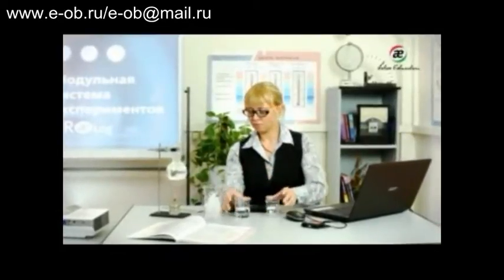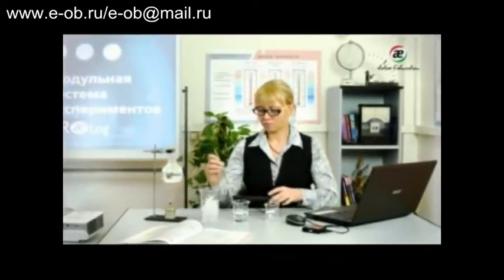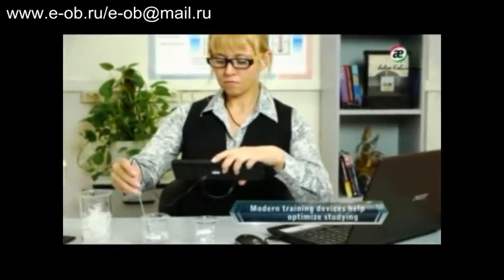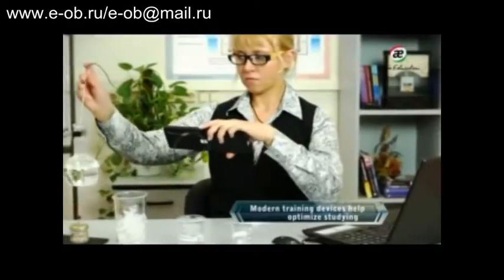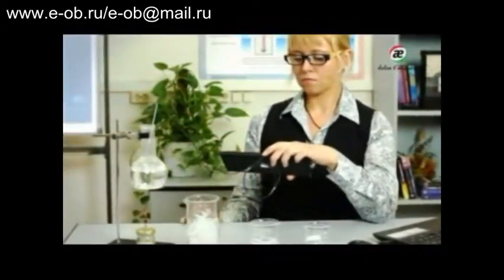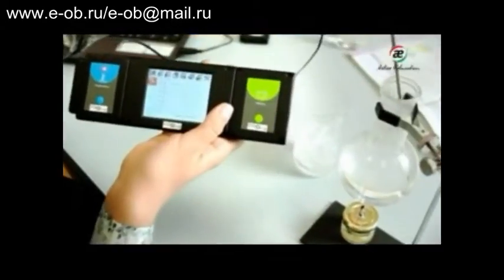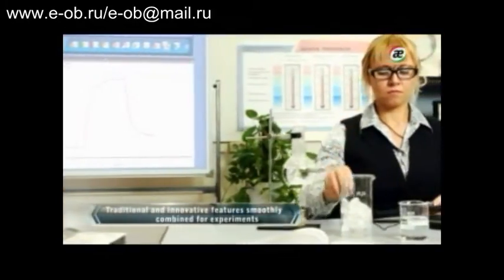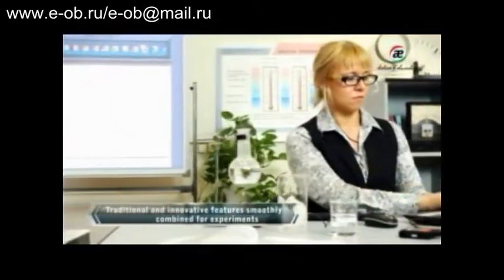Experiments are an important part of studying natural science at school. Nowadays, along with traditional equipment for experiments, people are increasingly using more high-tech learning devices. The PROLog science learning system is one of them. You can use PROLog in class to enhance the quality of your experiments. It also helps save time by automating various stages of work.